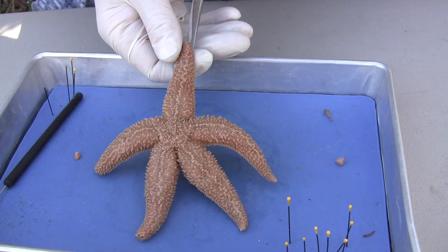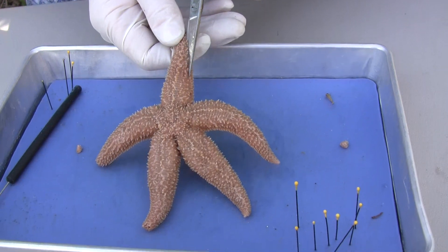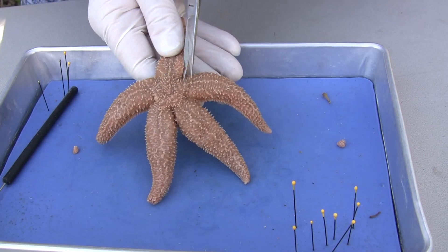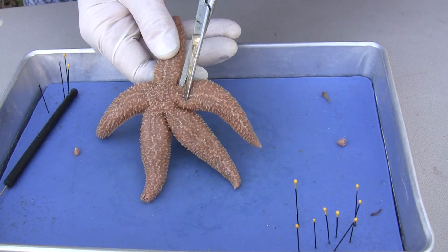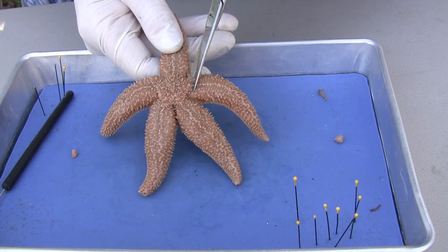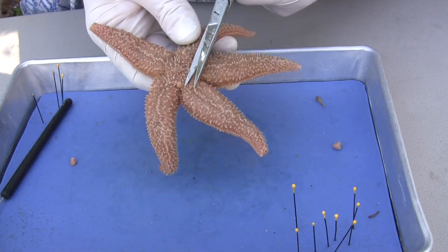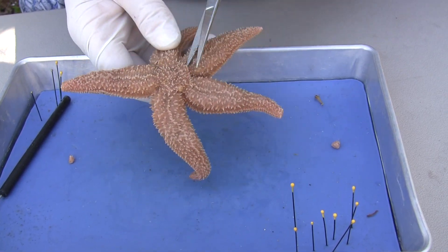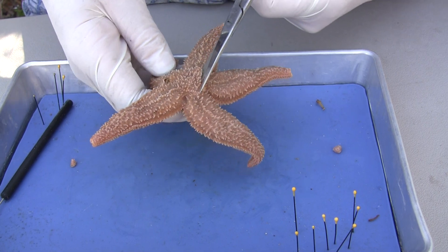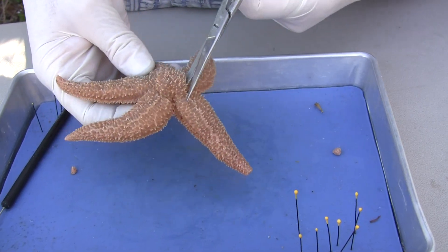So I'm going to go laterally and remove the skin on one of the rays. I'm going to go to the side here and then remove the skin off the top, going all the way around. Notice my angle — if I do slip and go straight, it's not going to poke me or my partner. Make sure your partner's hand is not in the tray. I'm not going to go very deep, but I don't want to miss that madriporite because there is a little tube called a stone canal that connects the madriporite to the ring canal. So I'm going to go just to the inside of that right there, come around, and remove that top right there.